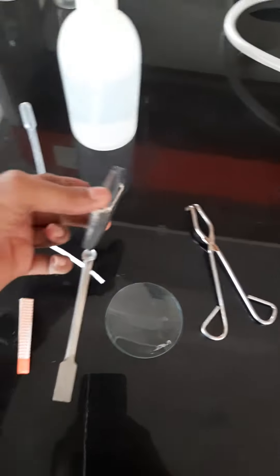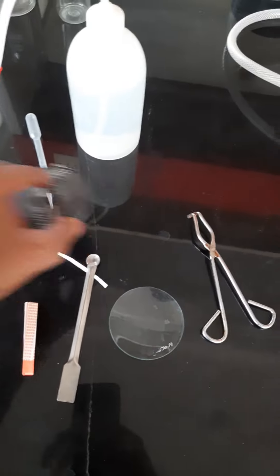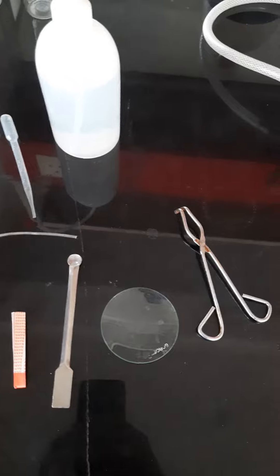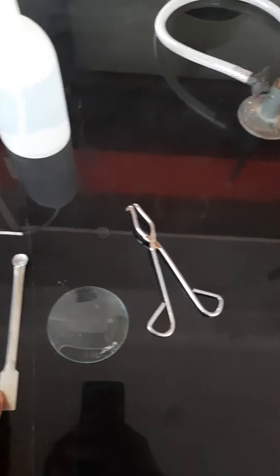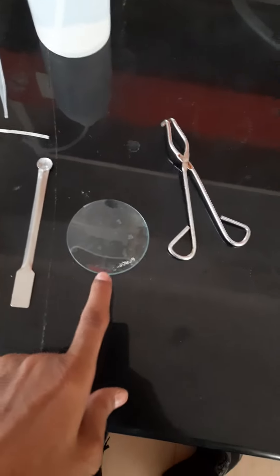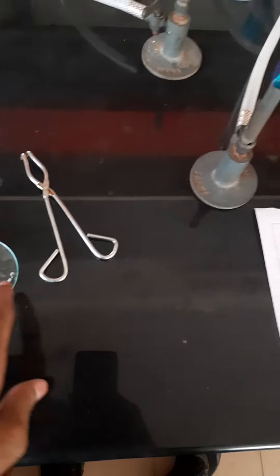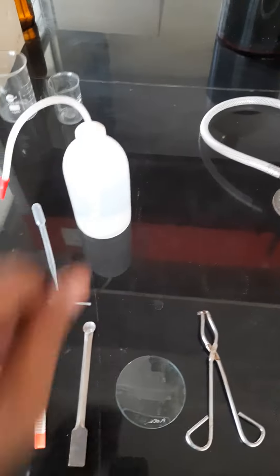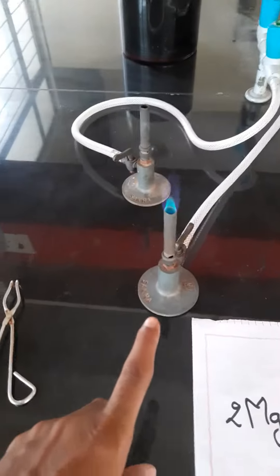This is magnesium ribbon. This is a spatula. And this is a petri dish and watch glass. This is a pair of tongs and distilled water. And this is called a Bunsen burner.